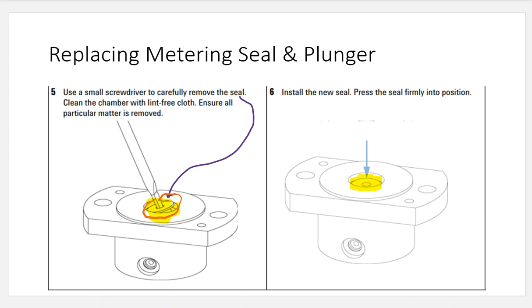There's a nice little tool that you can purchase, or you can use the end of a plunger, or in this case, it says a small screwdriver. I don't recommend a small screwdriver, but it's there if you want to go that route, I guess. But you're going to pop that seal out. This seal does get gunked. The seal does see some sample. So, we hope that it doesn't see a lot of sample. But it does see some mobile phases, and it's going to get used. It's going to get worn and torn. It's going to get dry rotted over a course of time. It's just going to wear itself out like everything else.